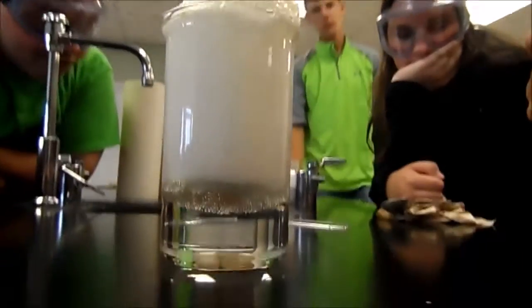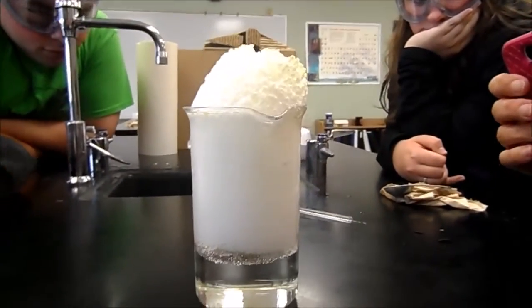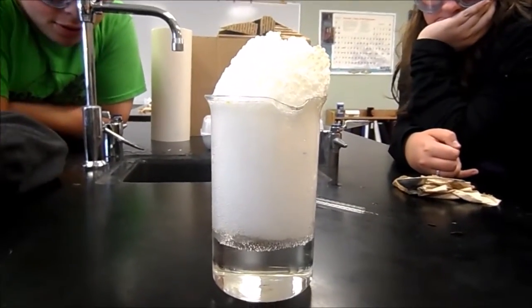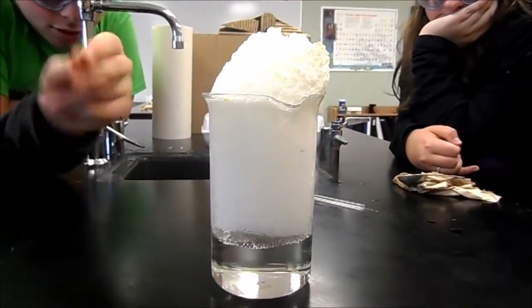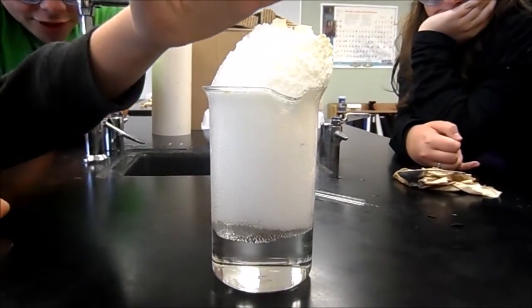Well, we always put in more acid than egg, of course. But I mean, it was running out. Look at it. You're raising the camera. You're like, it was getting good angles, Alvin, it was being great.